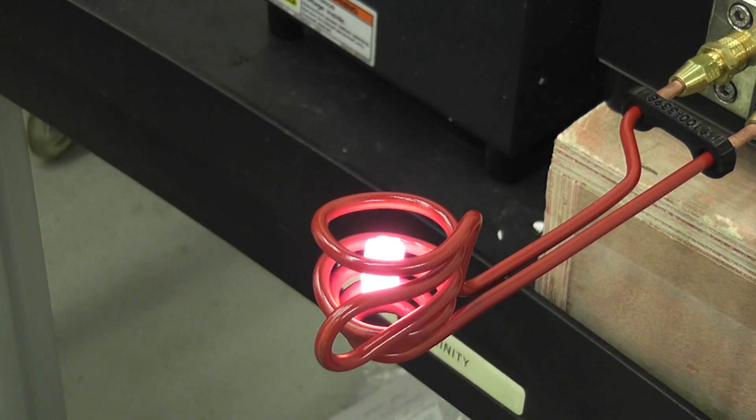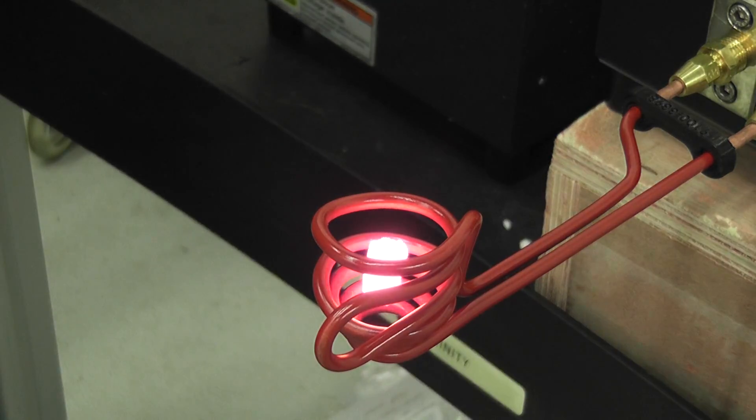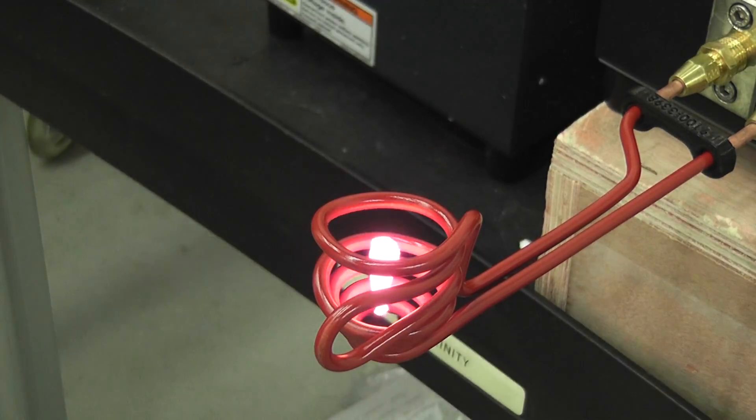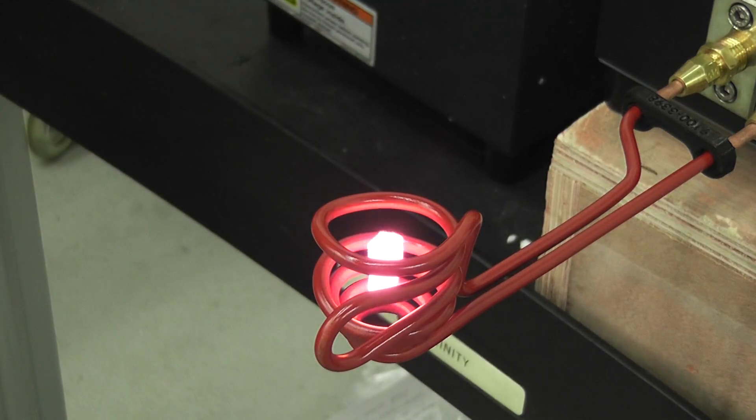You can experiment a little bit with the top turn, how far, how close it is. I can't, I'm doing it. Okay, okay.